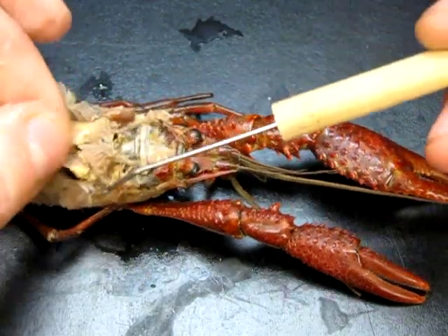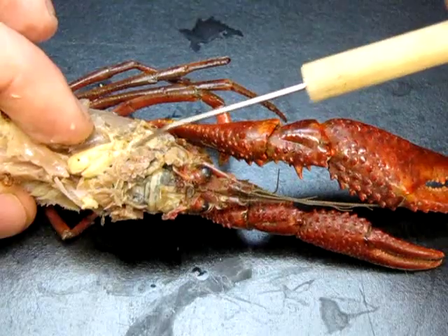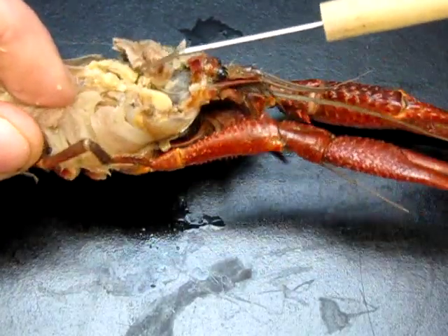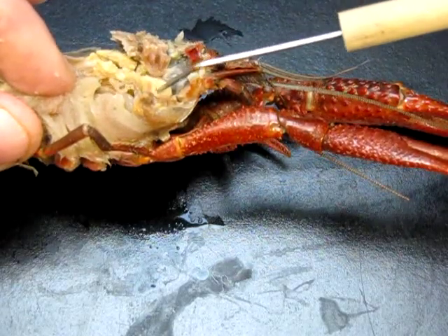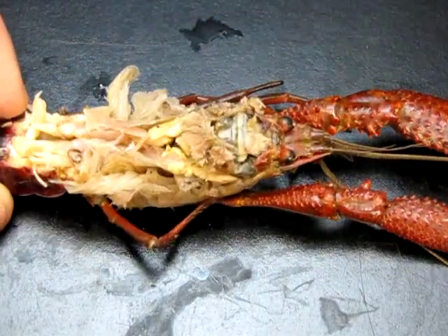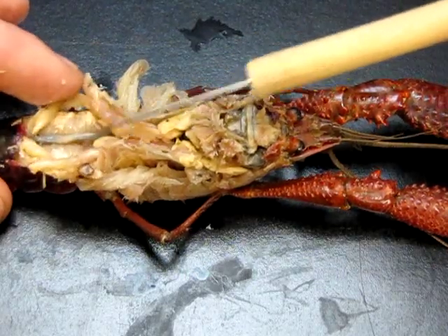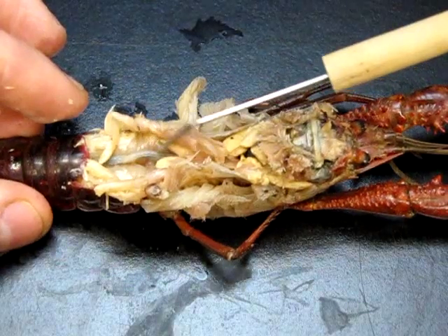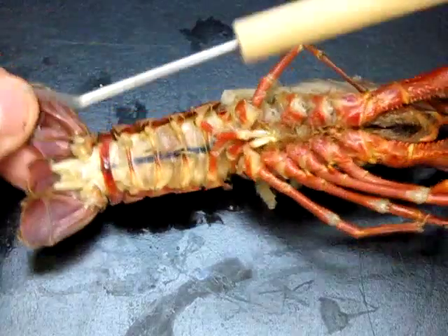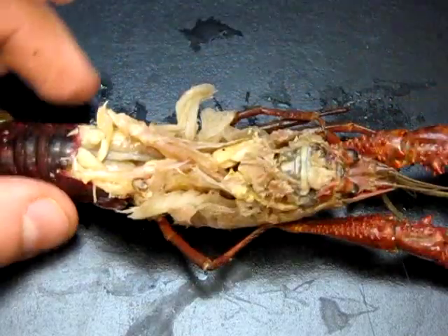There are a pair of digestive glands — they're pretty big. All of this beige material on either side is digestive gland. Moving further down the body and spreading the muscles aside, you can see a nice tube — that's the intestine. And the anus is just right in here, so you can see a complete digestive system.